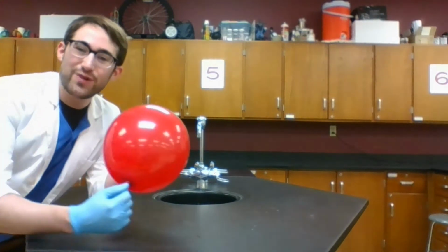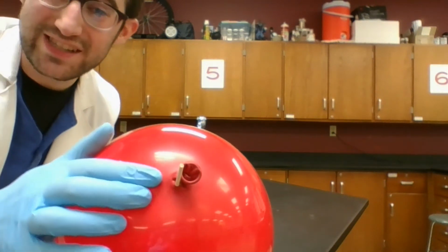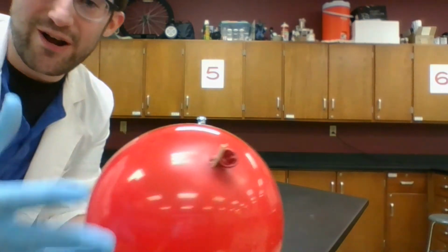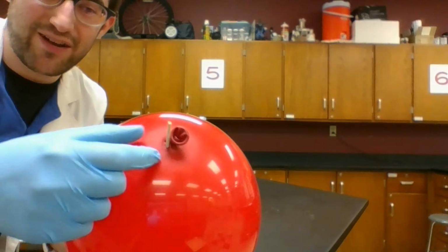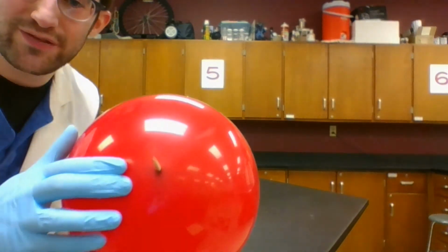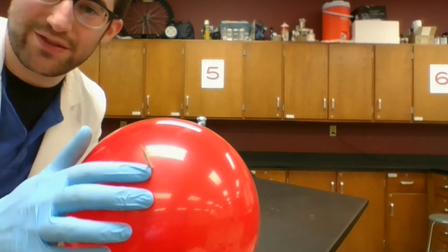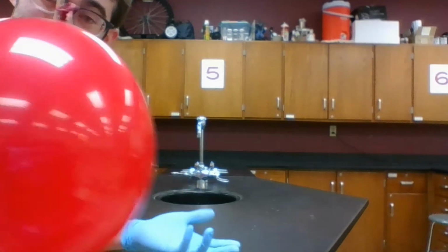Okay, the best way to do this is to go through the bottom of the balloon where it's thickest, where it's darkest. Okay, where you see you still have some rubber polymer to stretch around, and to hold tight around that so it doesn't leak. And same at the top, where you've got a dark part there. You want to go through the bottom and through the top. Okay. If you can't get it to work, your balloon might be a little too big.